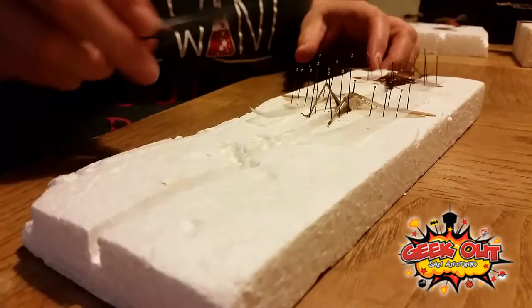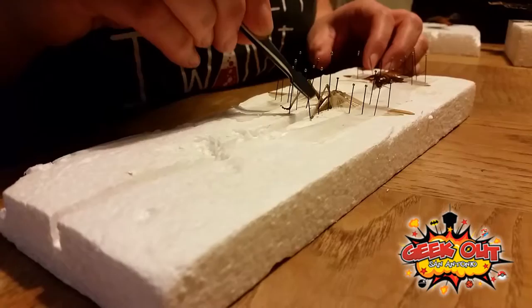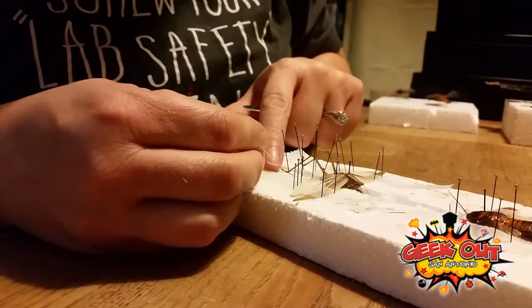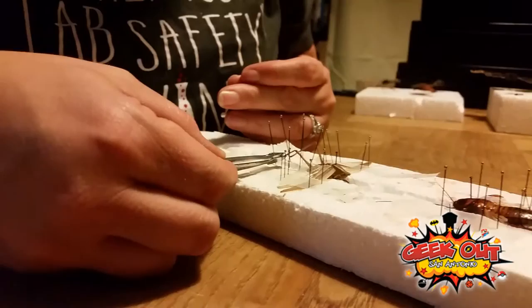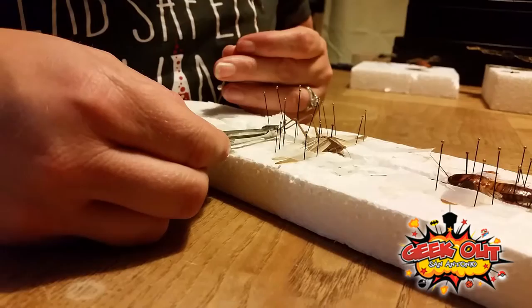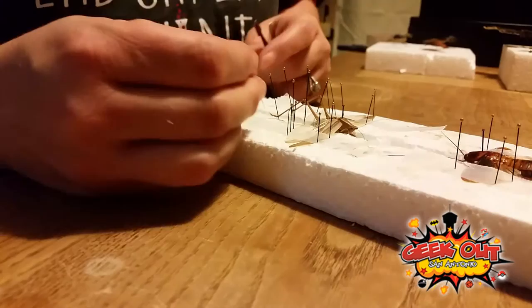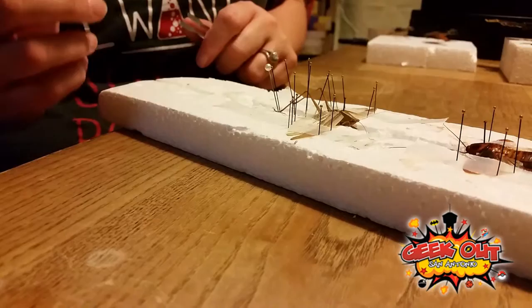And he slipped. Usually the legs on grasshoppers are one of the hardest things to do — you might have to add another pin or two. You can use that claw and the pin to just get it. I was trying to put his leg up, because he's got that little groove. So I was trying to get his groove on the pin — trying to get his groove on. That's better, right?